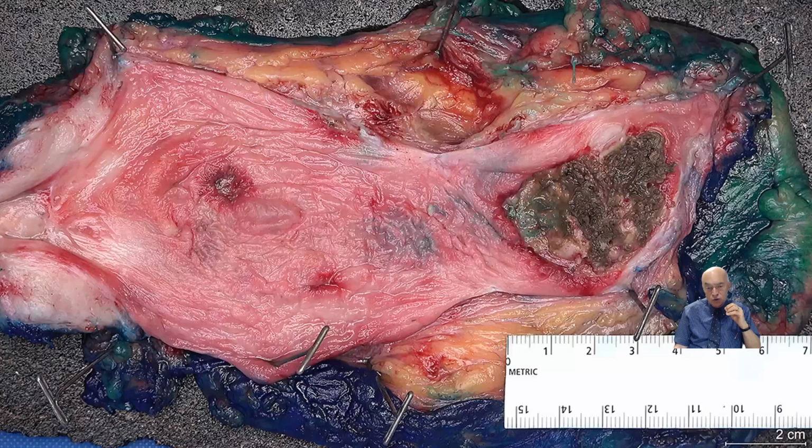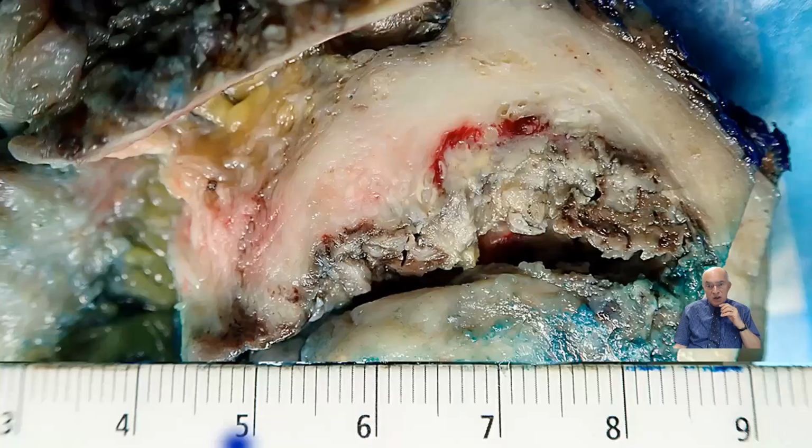Here is another case of a very typical tumor. Here, very papillary, and then all this area that appears to be solid with a more homogeneous appearance and going deeper, even into the fat. So this is very likely the presence of tumor with a very deep involvement of the bladder wall. And then, of course, we need to be very careful in taking deeper sections, even at the level of the surgical margins.